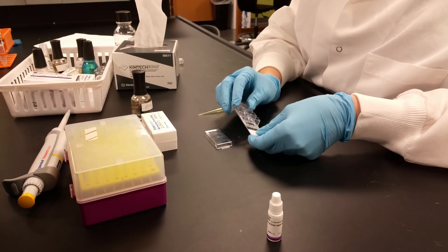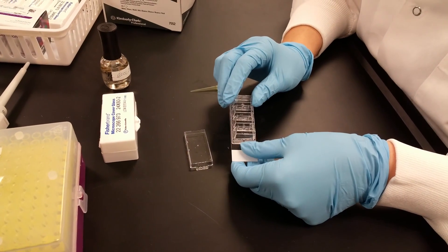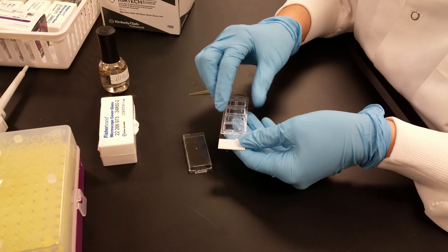Okay, so this is the last step of the protocol. This is after you have already removed the PBS the last time. Remember, you want to do this relatively quickly because you don't want your slides to dry out.